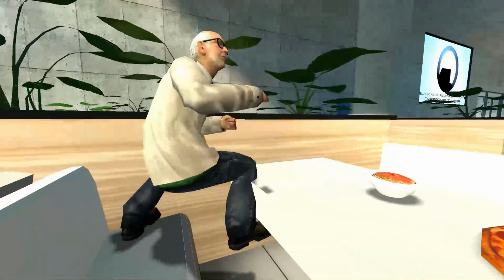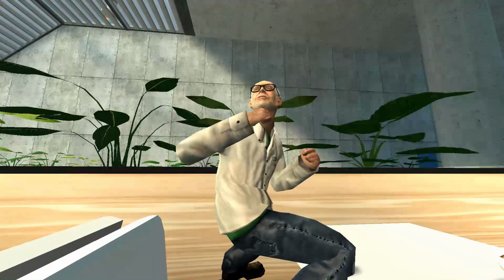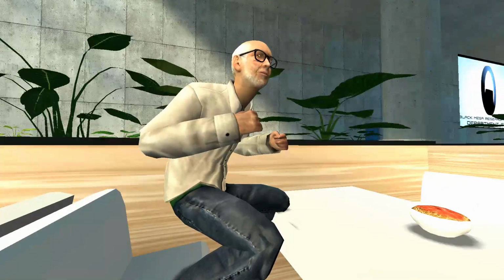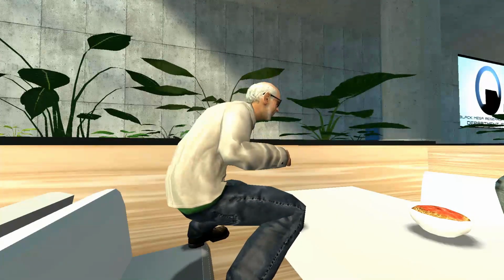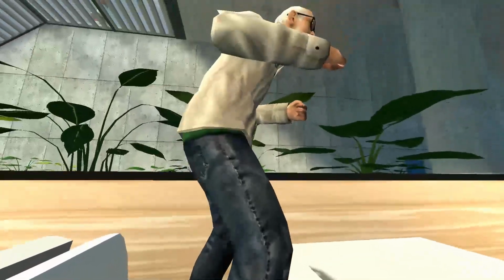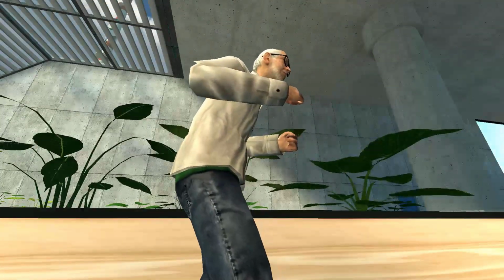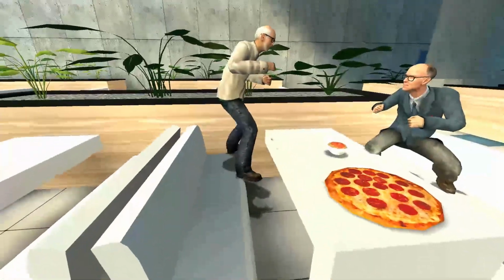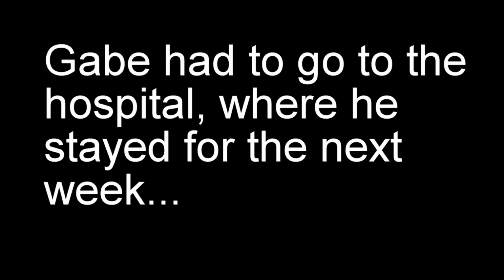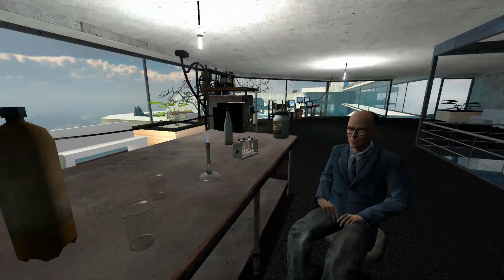Oh, wait. Gabe, did you wash your hands? Let's wash my hands? Yeah. Oh no. That's the big no-no right there. Gabe, are you okay? Maybe you need to wash your hands. I don't feel so good. Hey, you wanna get out? No! Call Maddie!